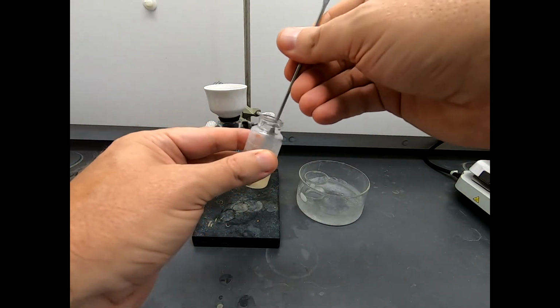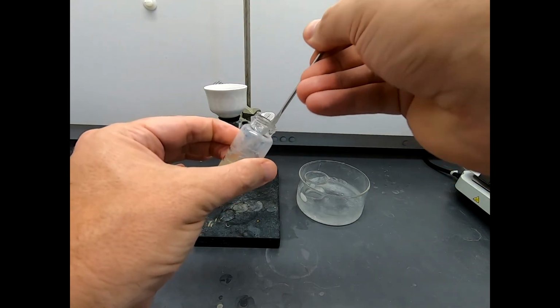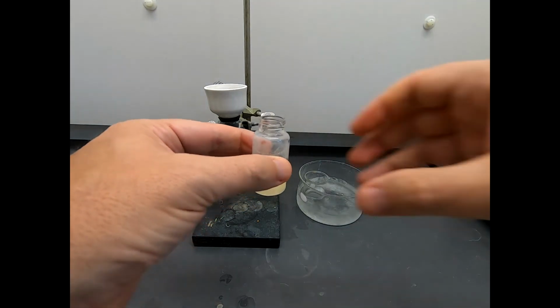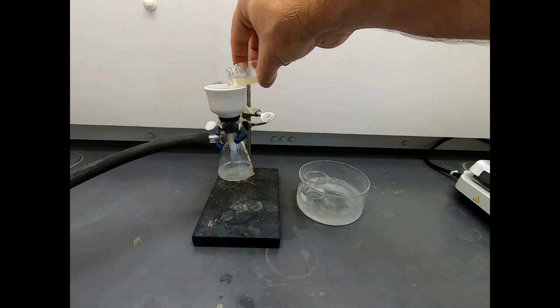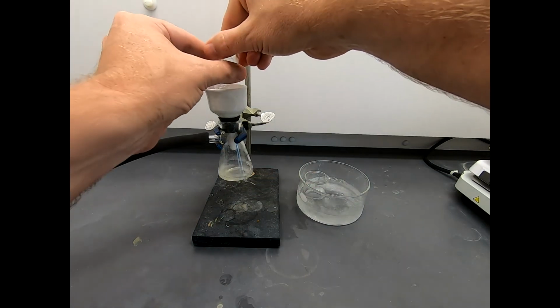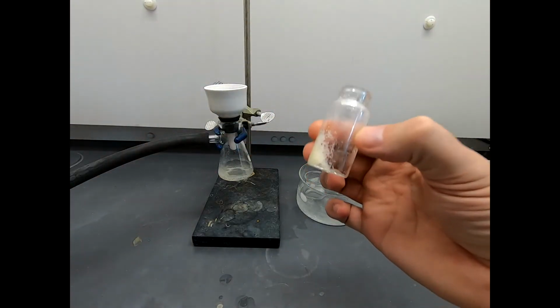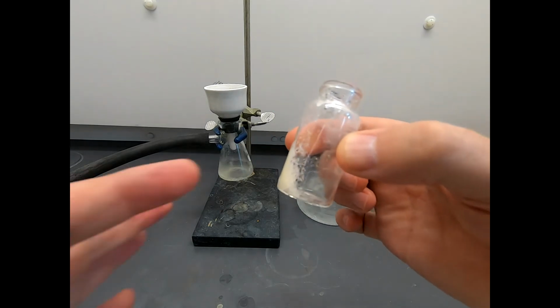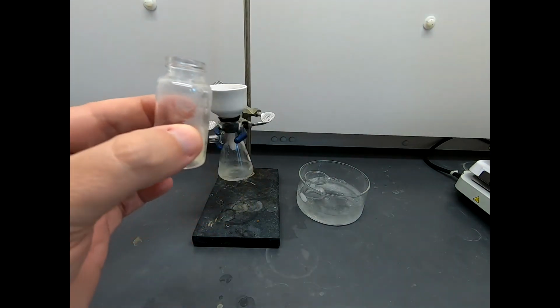And we will take this, and some of the solid is kind of sticking to the sides. I want to make it nice and loose, so I'm just going to break it up off the sides and off of the bottom. We'll do the best that we can. Great. And swirl it to suspend it and just dump it right on in. Beautiful. Now, you know what wasn't beautiful was I kind of did that slowly, and if you look, I did a combination of pour and a combination of a decant. So a lot of my solid just stayed because this neck is a little bit constrained.